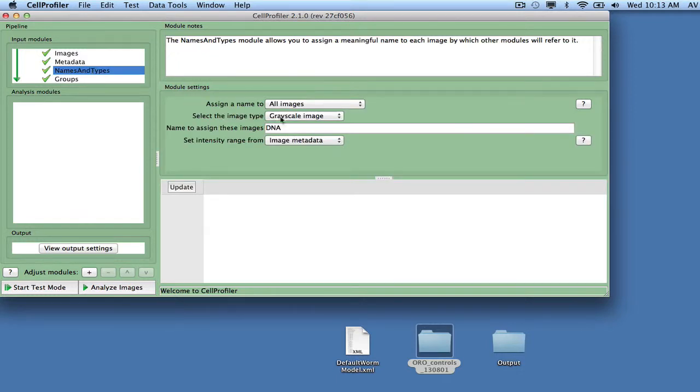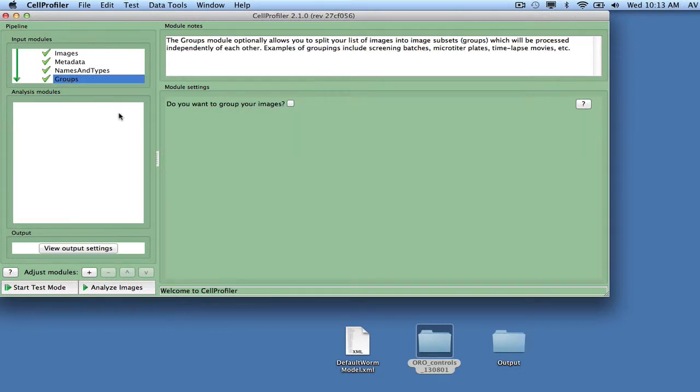Next, select the input module names and types. Set the input image type to color image and assign the images the name RawData. No grouping is needed, so the groups module can be omitted as well.